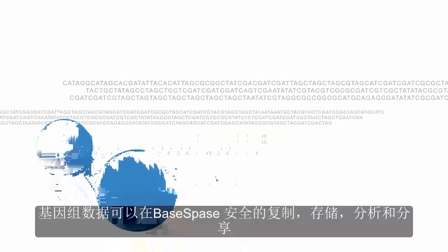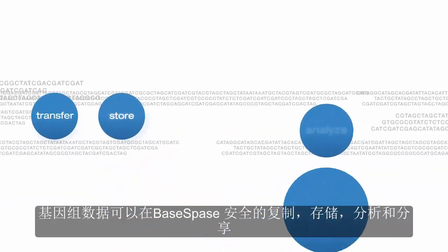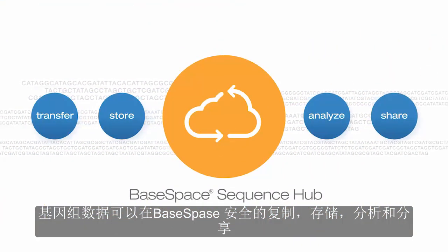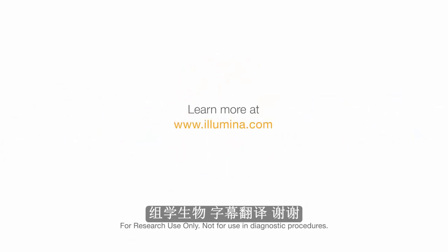Genomic data can be securely transferred, stored, analyzed, and shared in BaseSpace Sequence Hub. Discover the possibilities of next-generation sequencing.